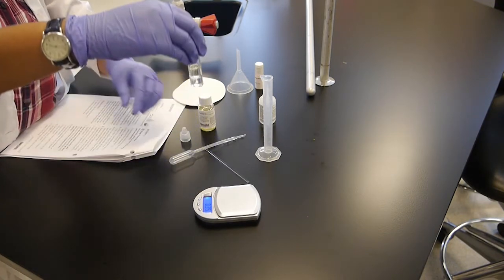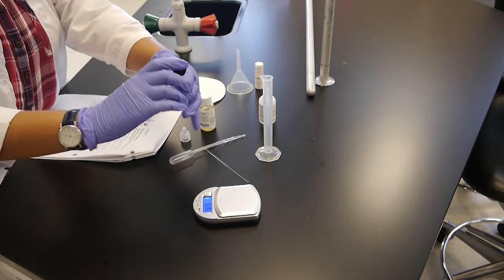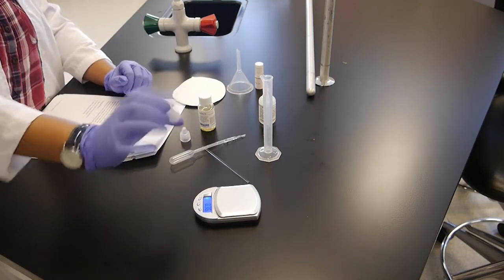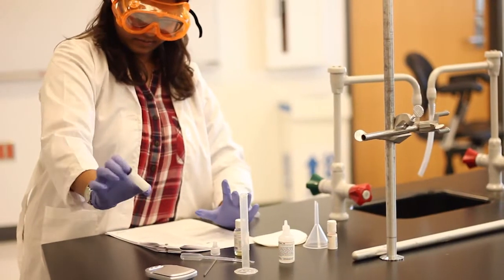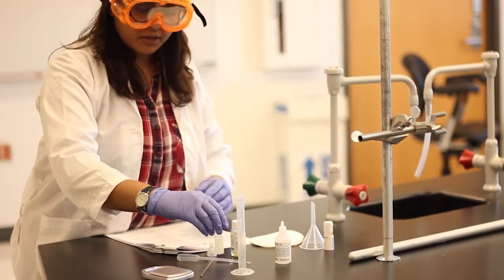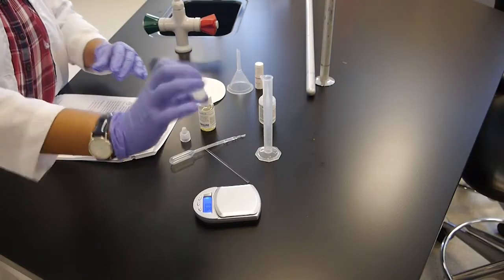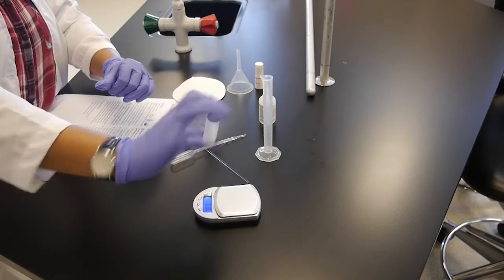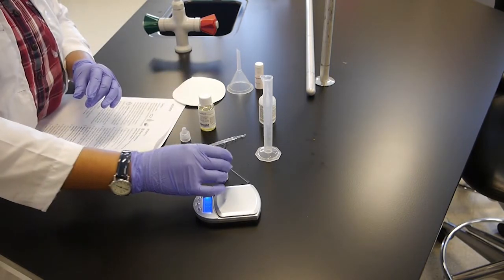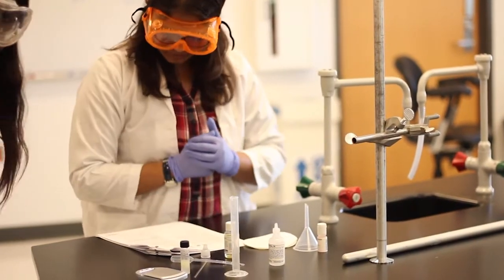So, as you can see here, there are 2 distinct layers, the oil layer and the sodium hydroxide layer. Then, let's shake this vial vigorously. Then we can wait for 10 minutes to see if it separates again. Keep doing this until there are no distinct 2 layers. Mix it well, and we're going to keep this for 72 hours for the soap to form. So we'll be back in 72 hours.